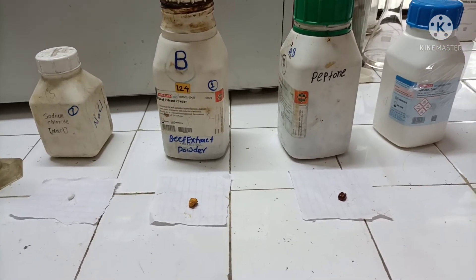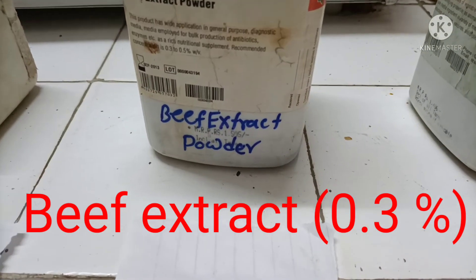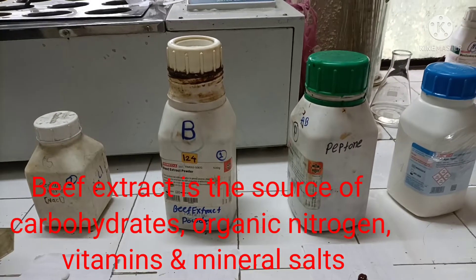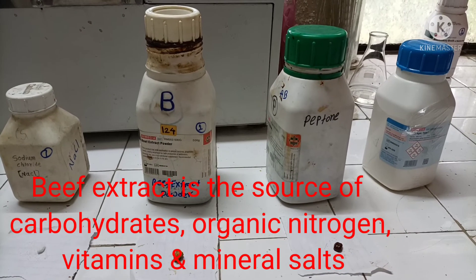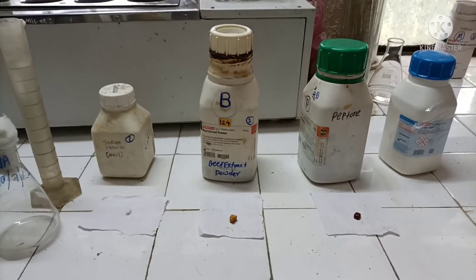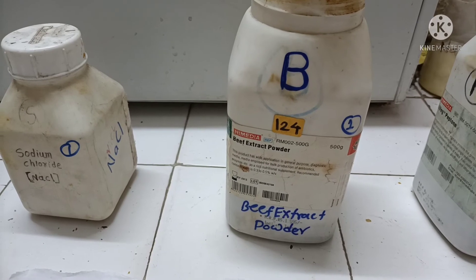Peptone at 0.5 percent is added into the medium. Then beef extract — or yeast extract — is added at 0.3 percent. Beef extract is an aqueous extract of beef tissue; it contains water-soluble substances of animal tissue including carbohydrates, organic nitrogen compounds, water-soluble vitamins, and mineral salts. All these ingredients stimulate bacterial growth. When yeast extract is used, it is an excellent and rich source of vitamins.